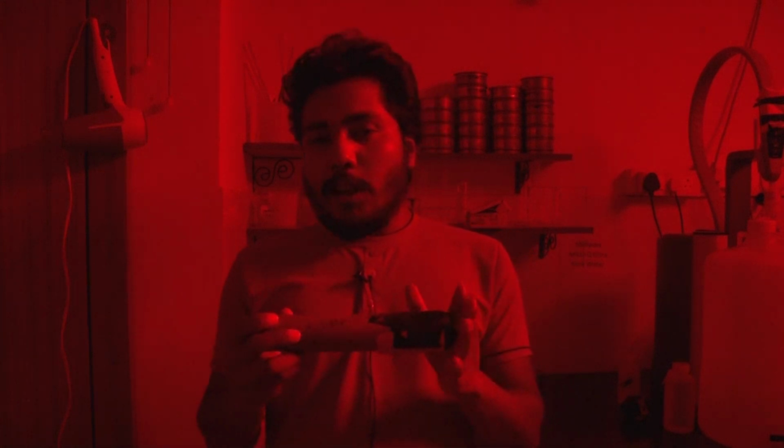So coming to the lab, you have to open your sample. To open your sample, there are a few things you have to keep in mind. The first thing is that maybe there was some light exposure while collecting the sample, so that portion you have to discard from the sample which you are going to take for the laboratory procedure. You have to discard 3 cm from both sides.